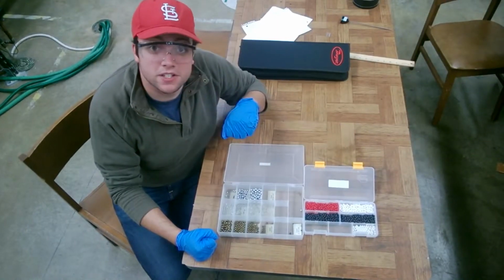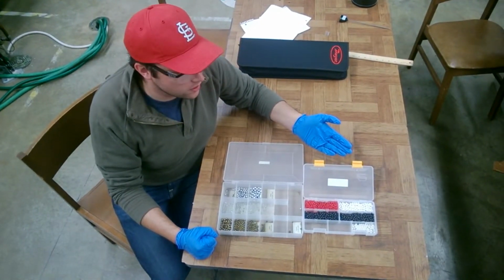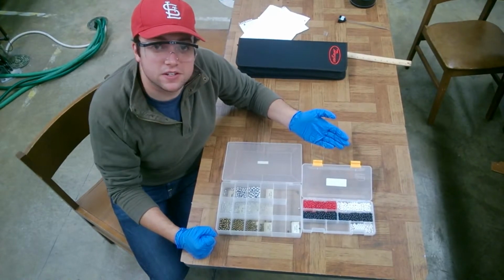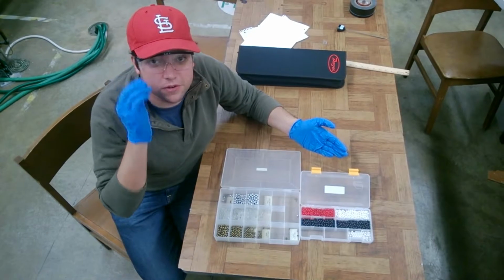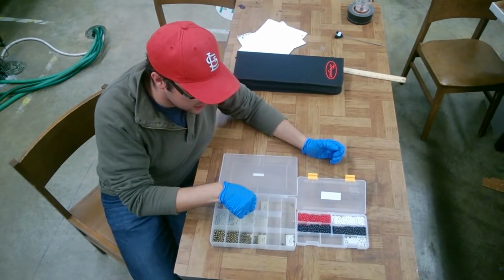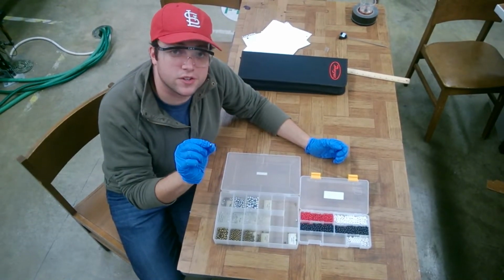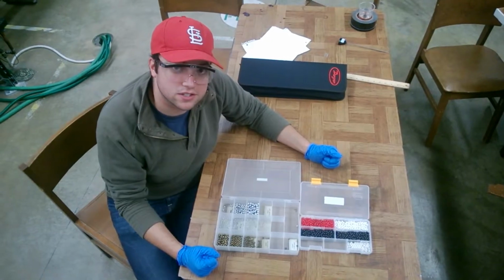In using the falling sphere viscometer, you will be choosing 9 unique spheres. It is important to keep in mind while choosing these 9 spheres which ones will tell a good story with the results you are dealing with for your design of experiment. After you have chosen your 9, record the diameter of each and also the mass so that you can determine the density, and this value will be used in further calculations.